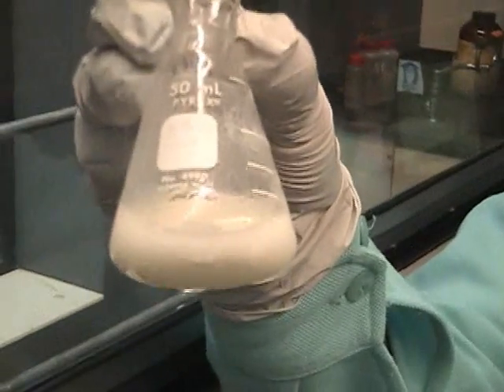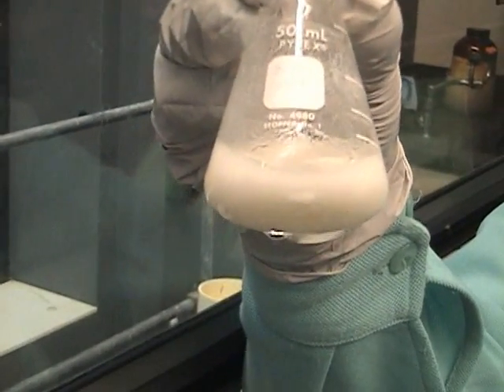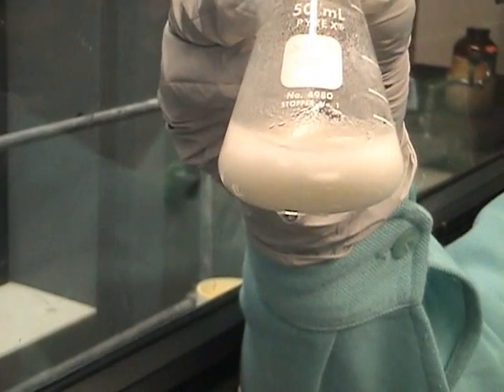Once all the ice has melted, collect the crystals by vacuum filtration.